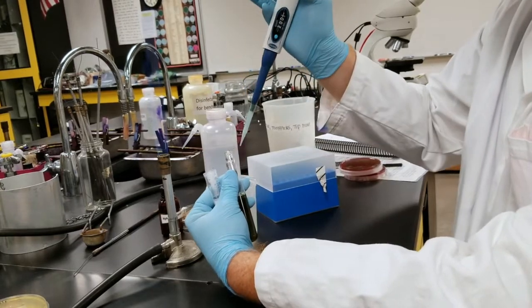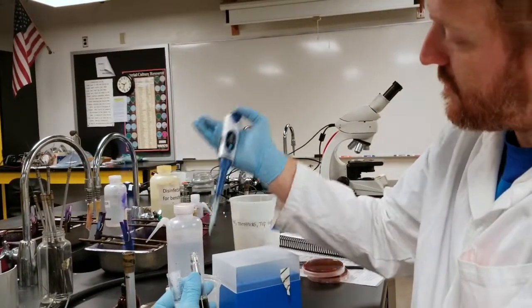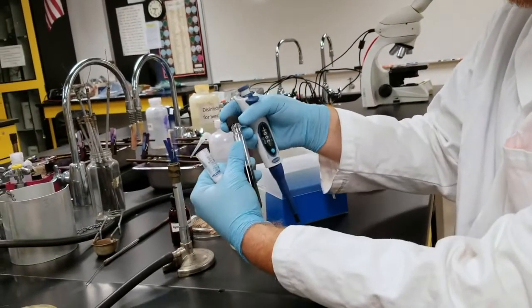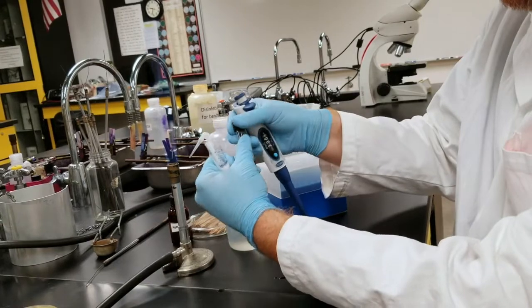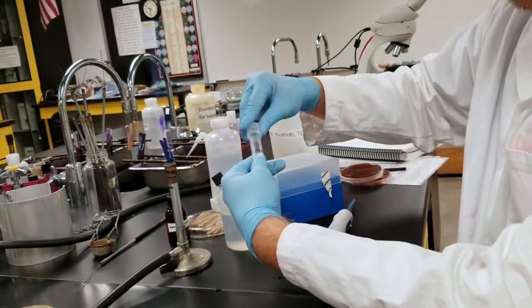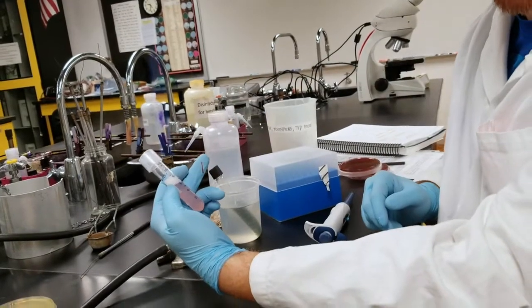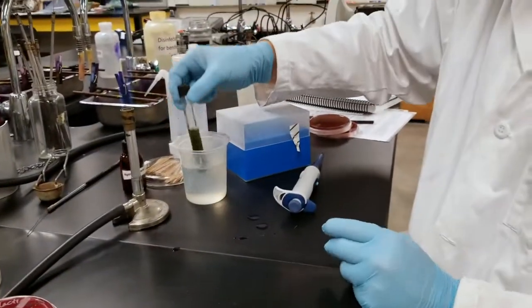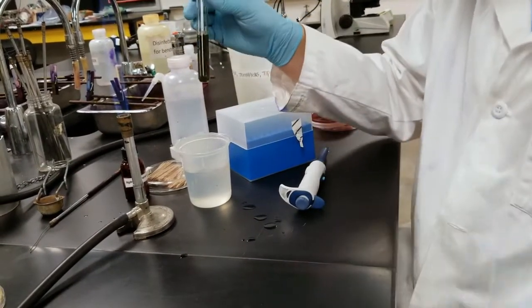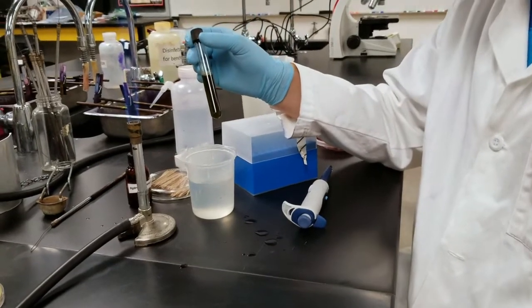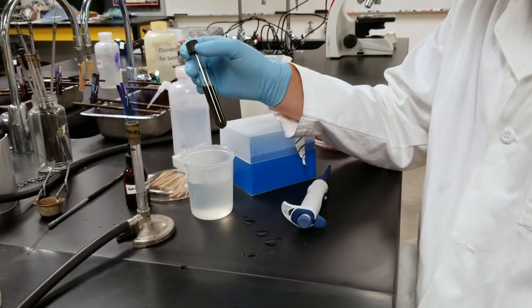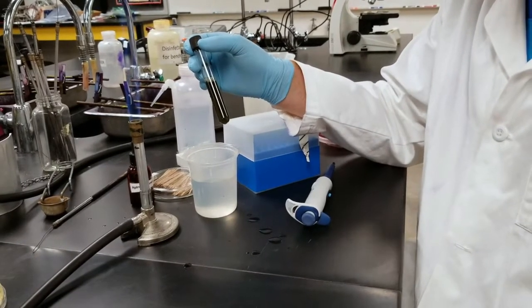And then using this button here, I'm going to remove my tip, put a flame and close my tube. Then discard my saliva in my media waste. Now to solidify your Snyder media, I'm going to mix it up a little bit. But to solidify this, all you need to do is run it under cold water. We're not going to show that in the video because that is very self-explanatory.